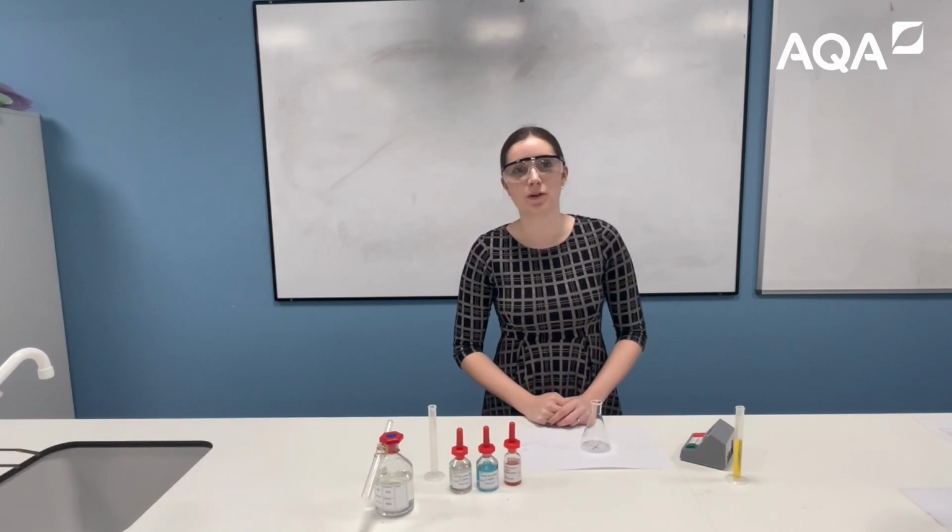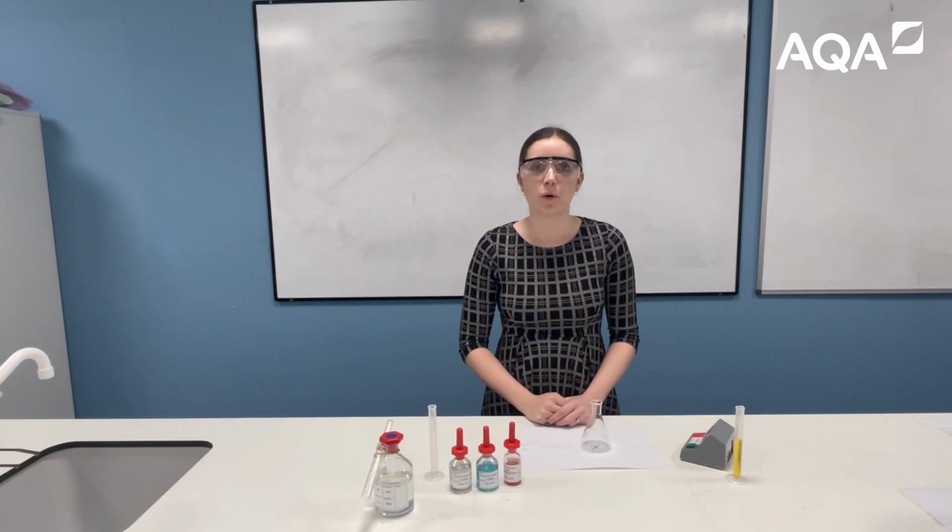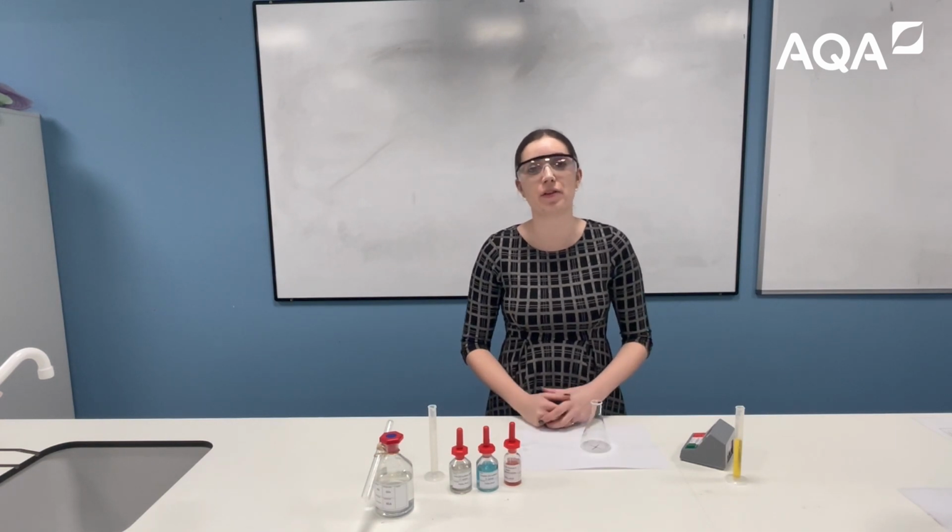Hello everyone, my name is Katie and I'm here to show you a class practical that you could do in the classroom. And this one is called the appearing cross method or the disappearing colour method.